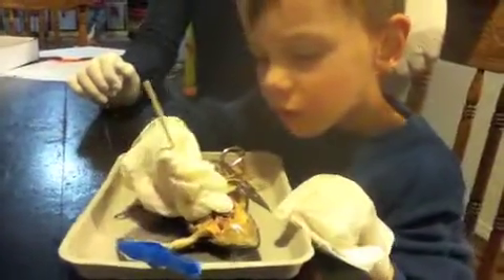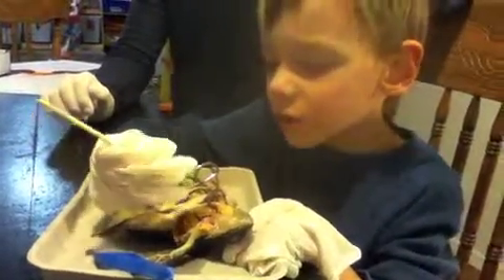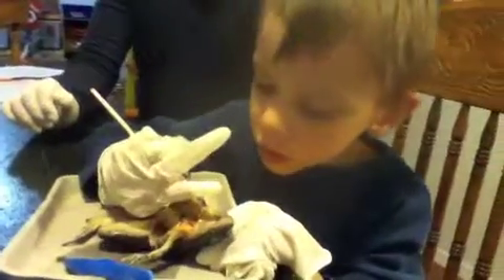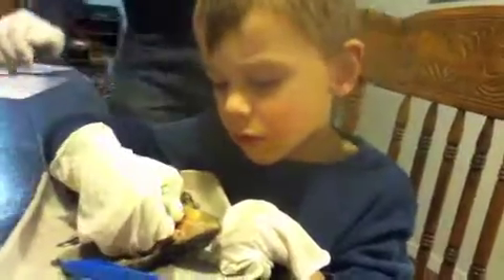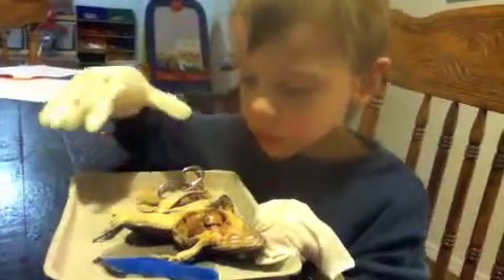Go ahead, Harry. Take your hands and dig around in there and see what you can find. I'm taking them out. What organ are you taking out? The stomach. You can use your fingers too to pull it out, honey. Do you need somebody to snip it out? Yes.